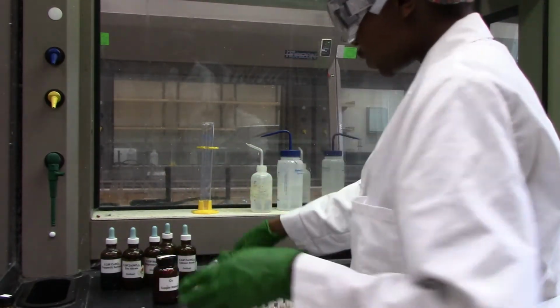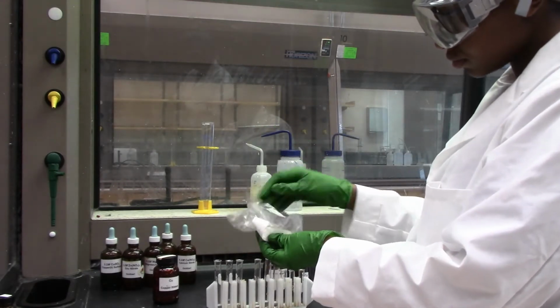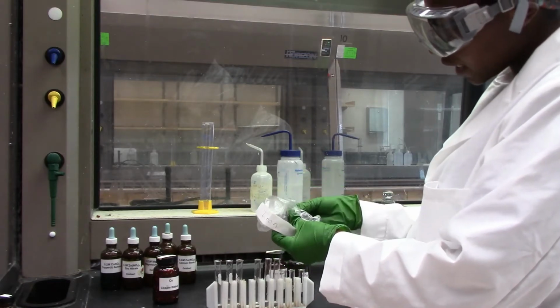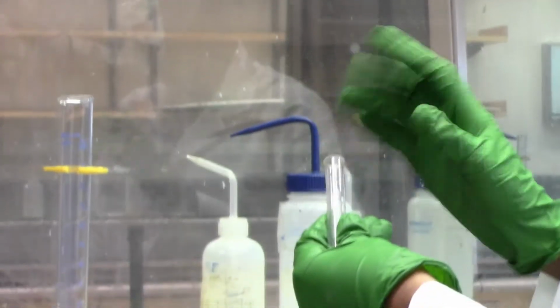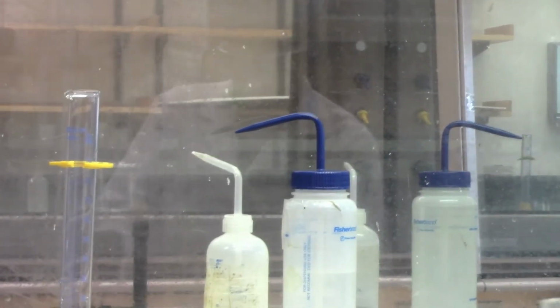And then I'm going to do the same. Take some iron. We are looking at the color, at what's happening in the solution. Are we emitting any gases? Are we forming anything? So this is iron, and I'm going to drop it in HCl.